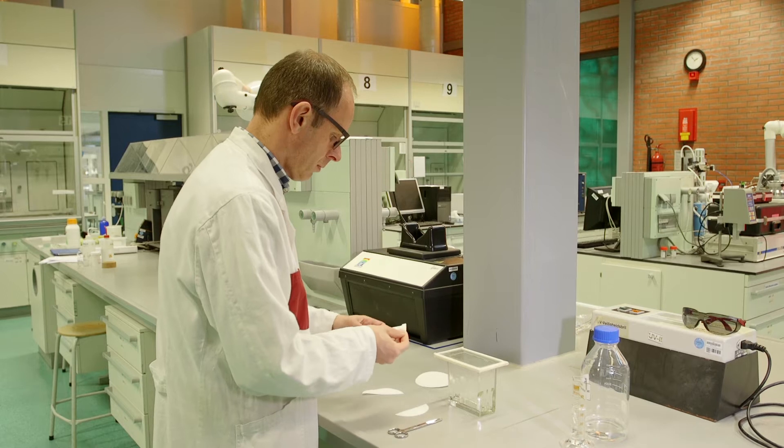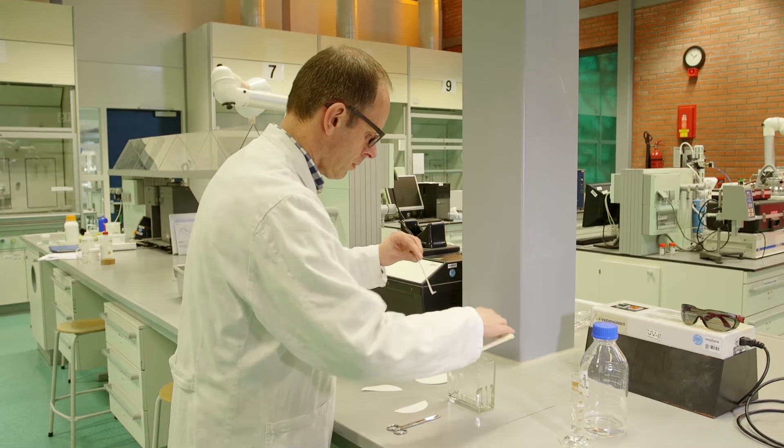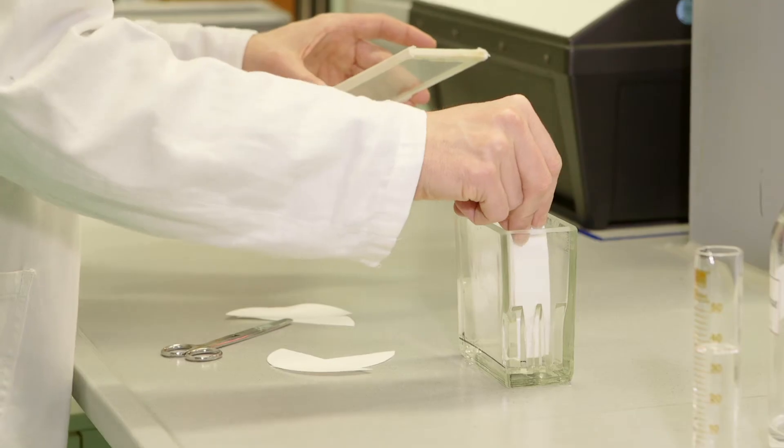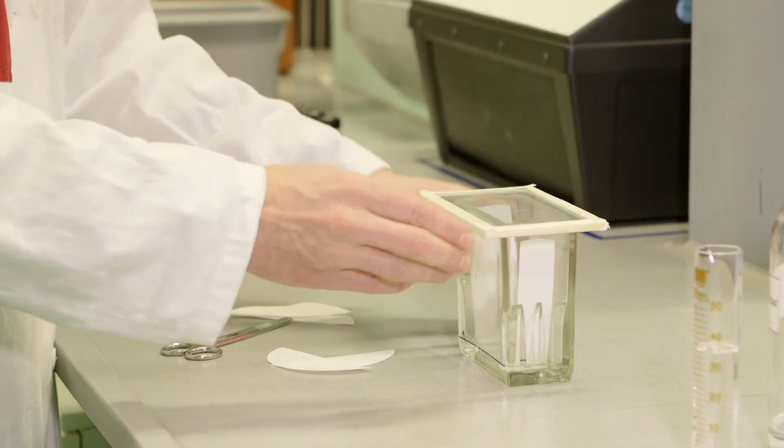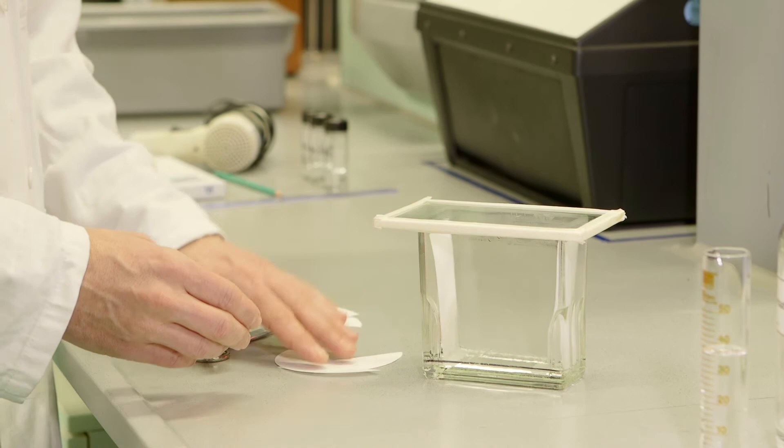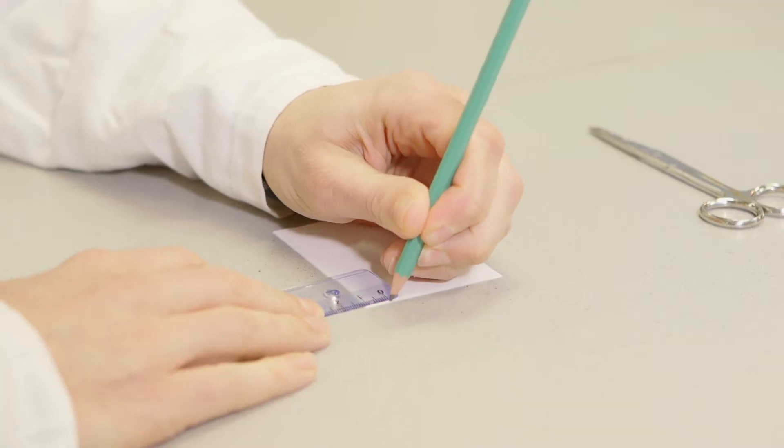Inside the tank are one or more strips of filter paper. The strips are placed in the solvent to establish a good equilibrium between the liquid and vapor. The lid is placed on the tank and left to stand for approximately 15 to 20 minutes.